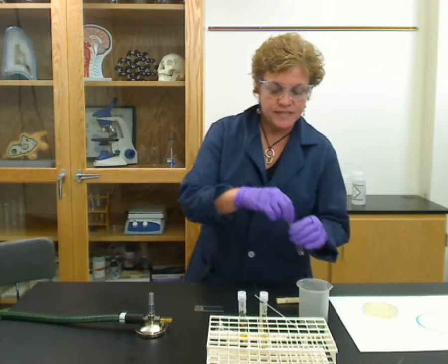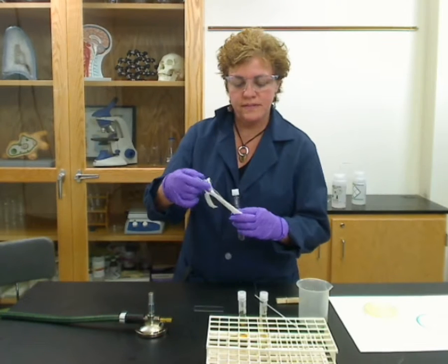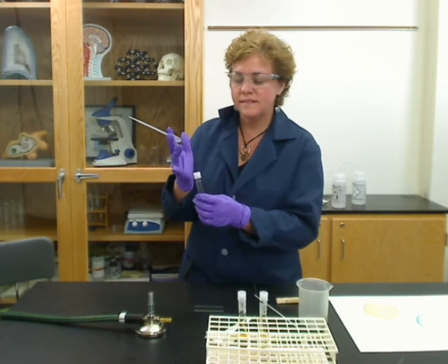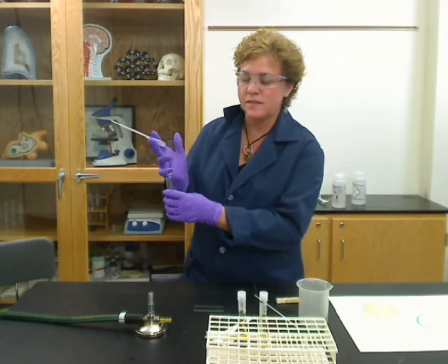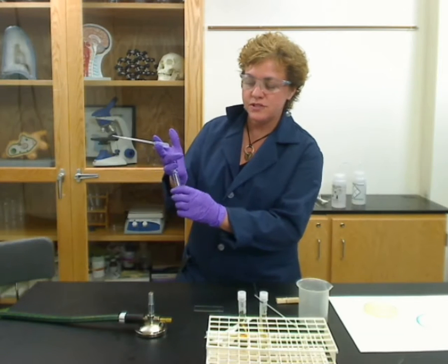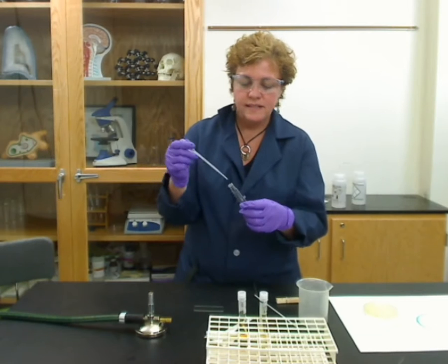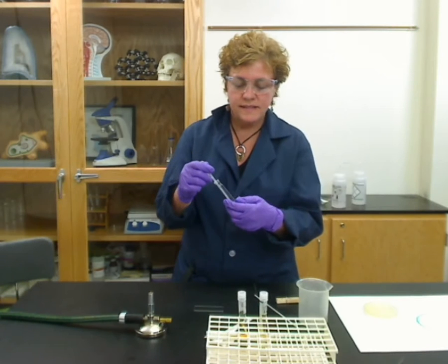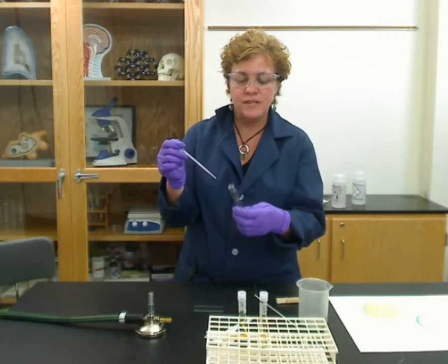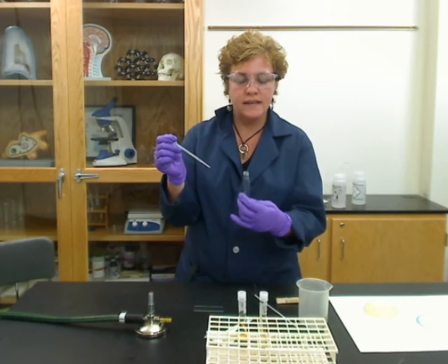The first thing you need to do is have a sterile dropper, because it's sterile water. In order to open these vials, you have to grab it by the pinky of your other hand and turn the tube so you can open it sterilely or aseptically. Take a sample of water — you only need a tiny, tiny bit. If you take very much water at all, it will take forever to dry, and that'll be a problem.